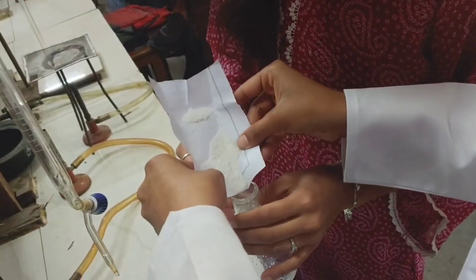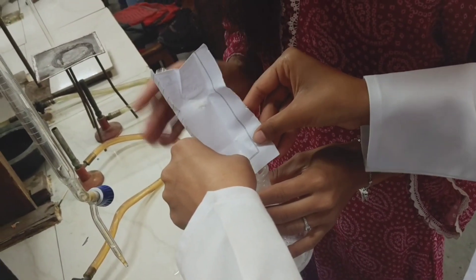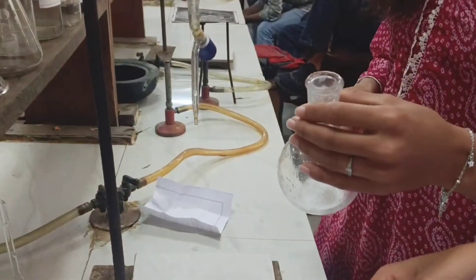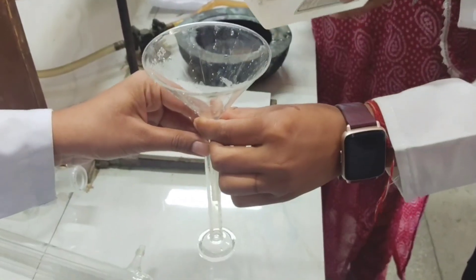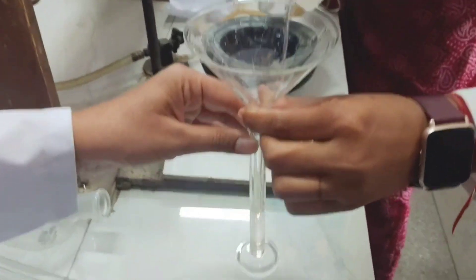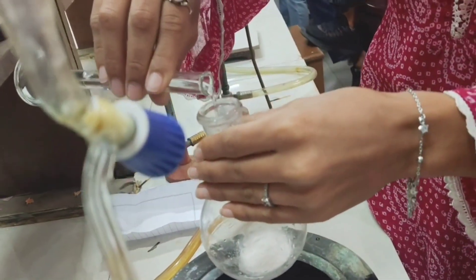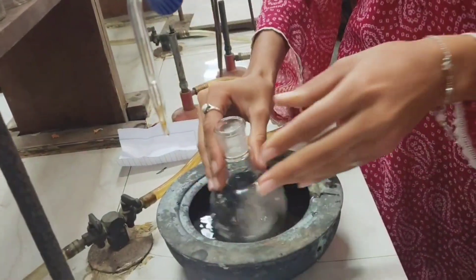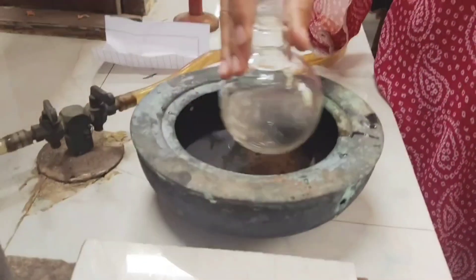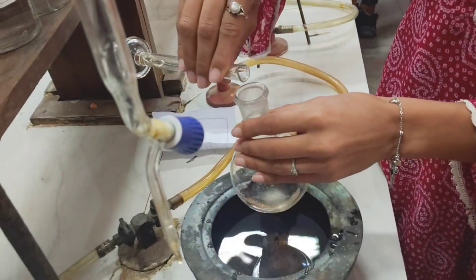Adding 5 gram of benzoic acid in the round bottom flask. Now add 12 ml of ethanol using measuring cylinder. Then we add 2 ml of concentrated sulphuric acid in this mixture.